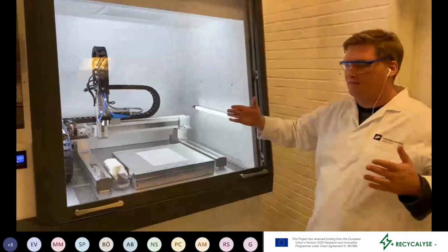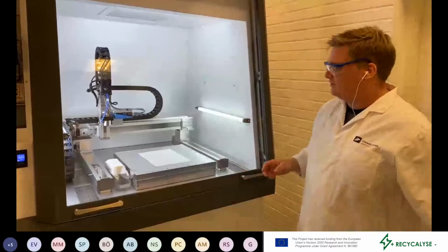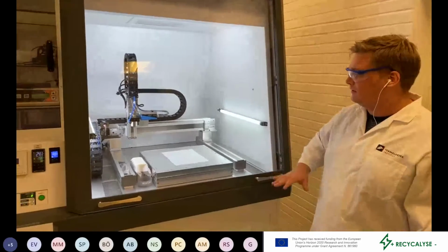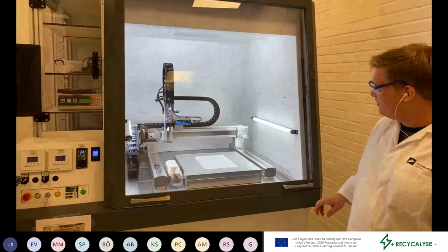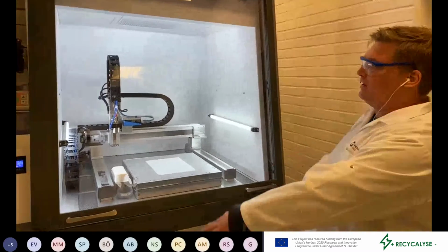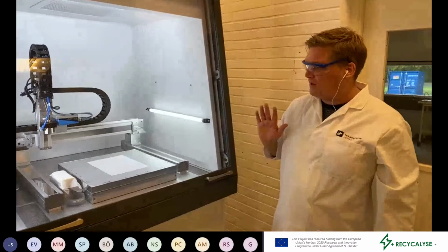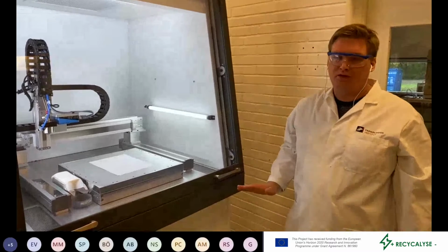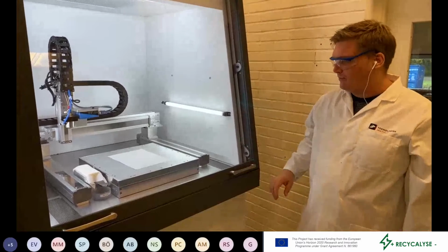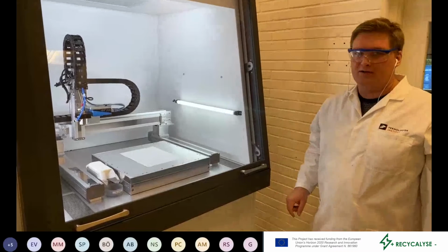The problem with the first one is that when you have the substrate plate moving back and forth, it's difficult to control the airflow over the electrode deposition robot. But in this one, because it's fixed, we have a controlled laminar airflow going through. This one we haven't tested that much, but it should be able to give even more uniform electrodes. From this we can basically make any size up to 40 by 40 centimeter electrodes.